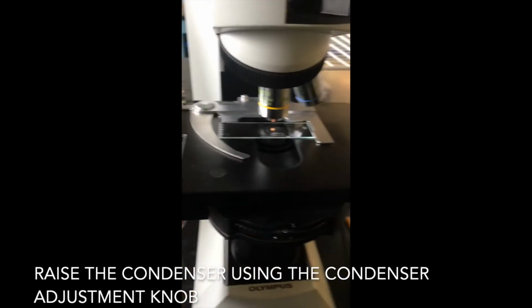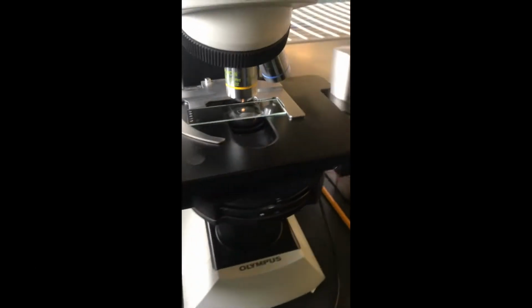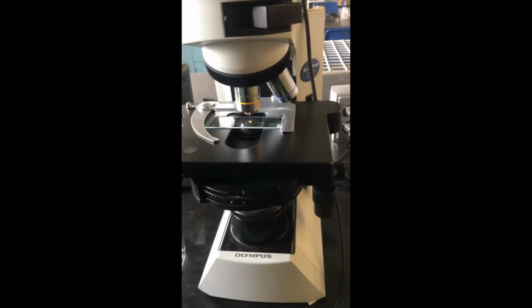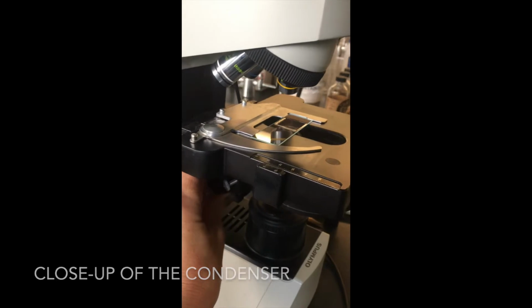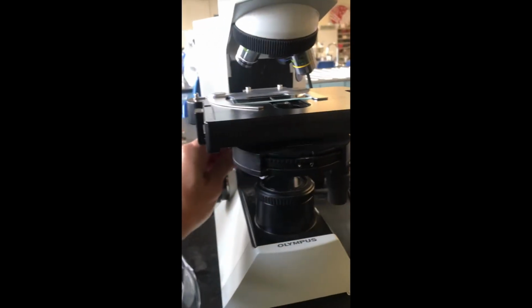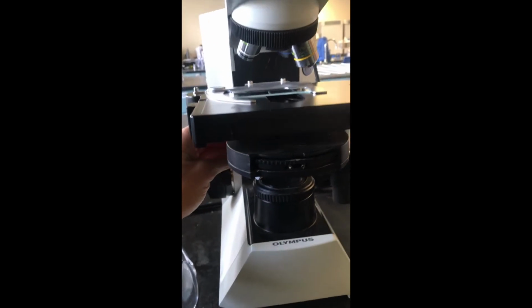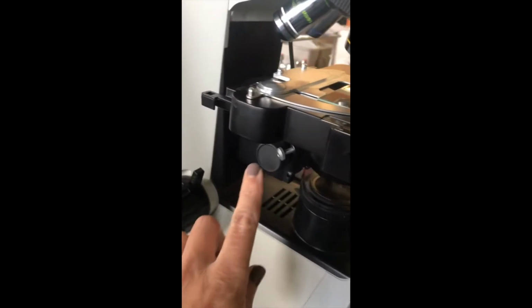We then use the condenser adjustment knob to raise the condenser to the highest setting. Here we have a close-up of the condenser and the condenser adjustment knob. You can see the condenser located directly under the stage, and as the dial is turned, the height of the condenser is adjusted.